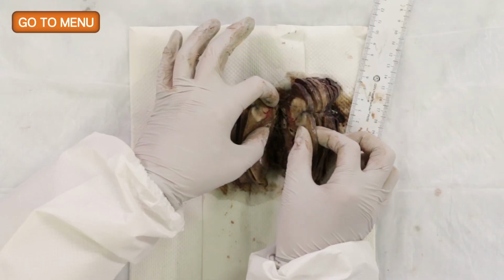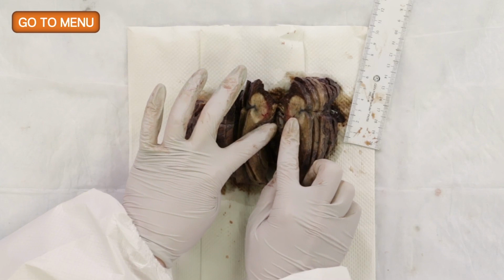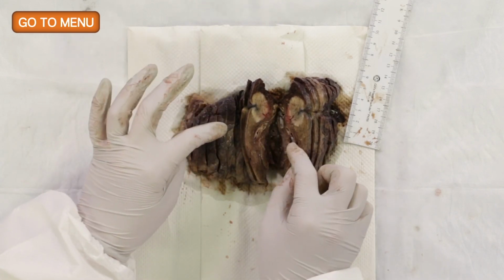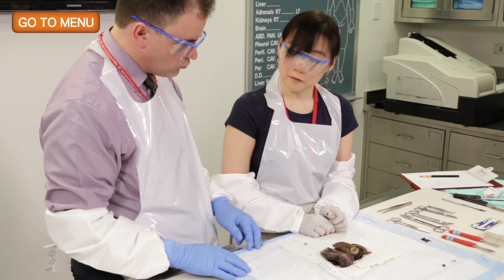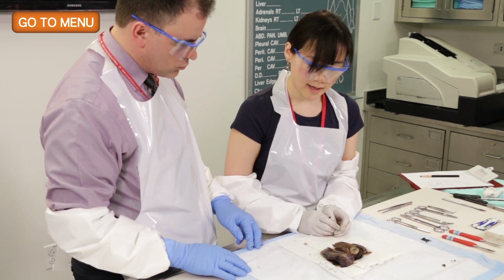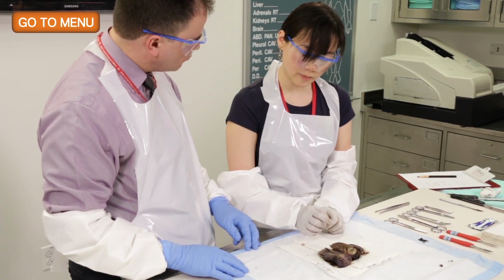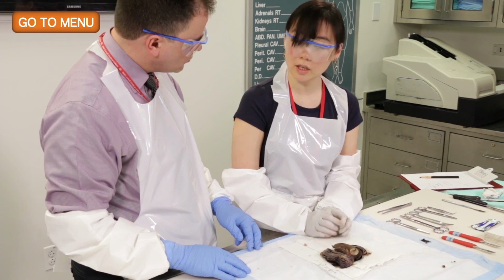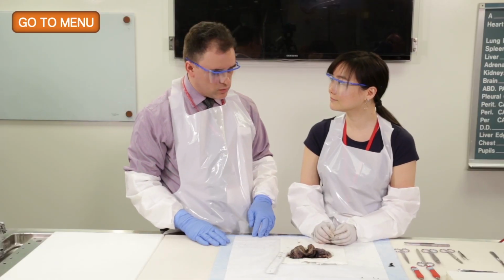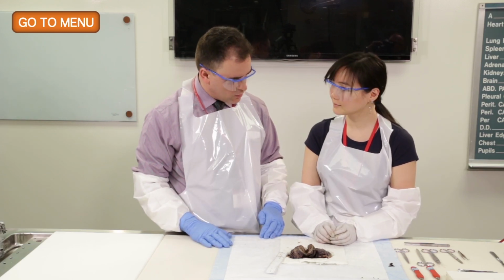So I want to take my appropriate sections of the tumor. So I'd like to take tumor to the closest bronchovascular margin, and I'd like to have full face of the tumor itself, if possible, of course, and of course the 2 sections with the pleura. So we also additionally want another section of tumor to normal. So standard sections would be to, again, assess stage. So I think those are all appropriate sections.